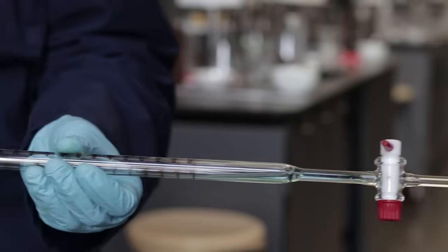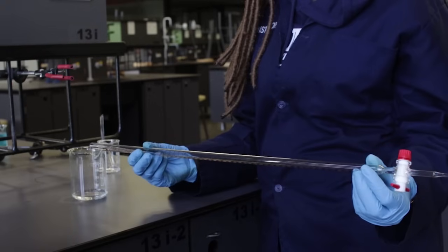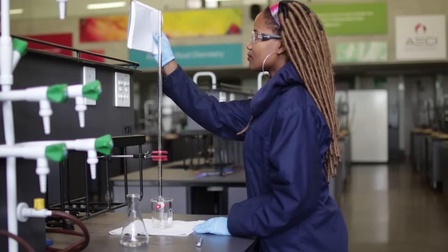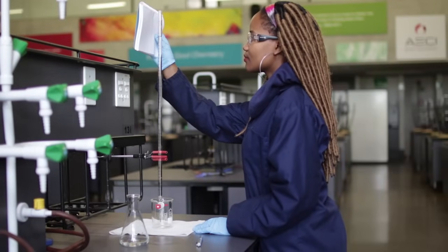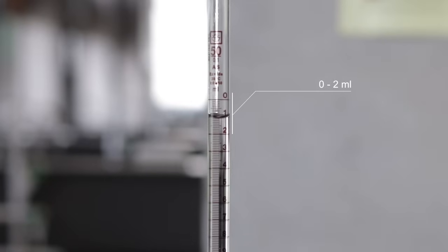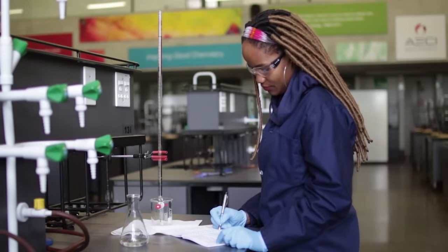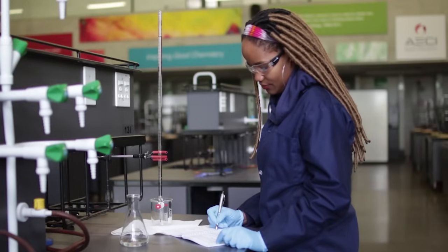The burette has now been cleaned and prepared as shown in the previous videos. The meniscus is level with any graduation mark on the burette between 0 and 2 milliliters. The initial reading will be recorded remembering to do it to two decimal places.